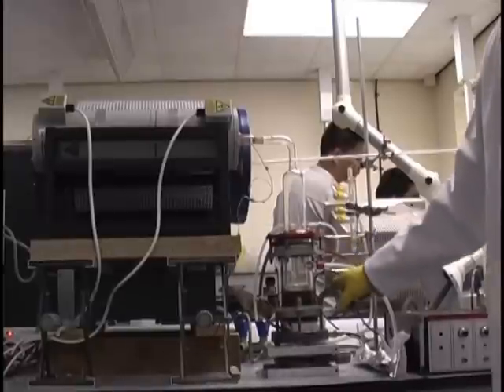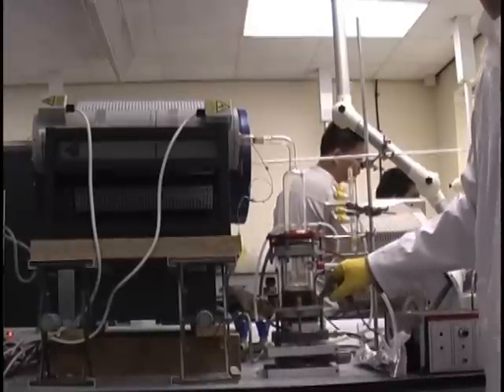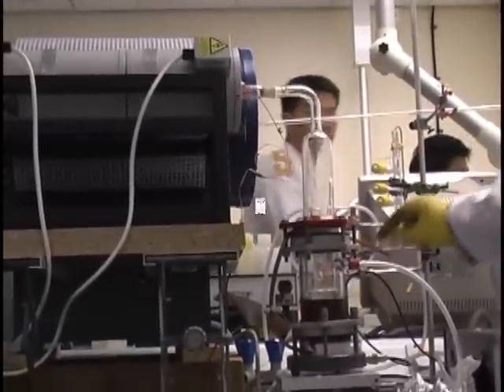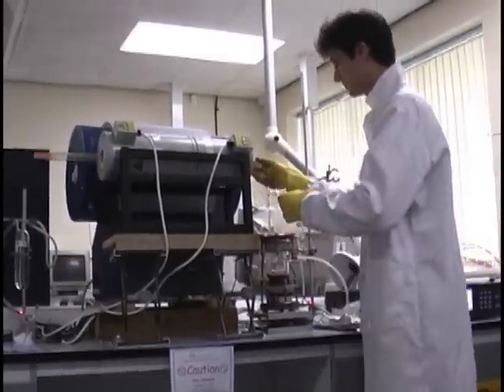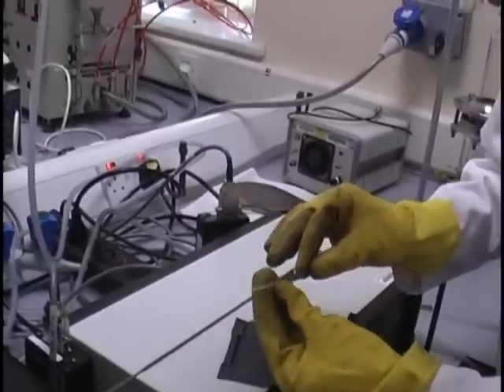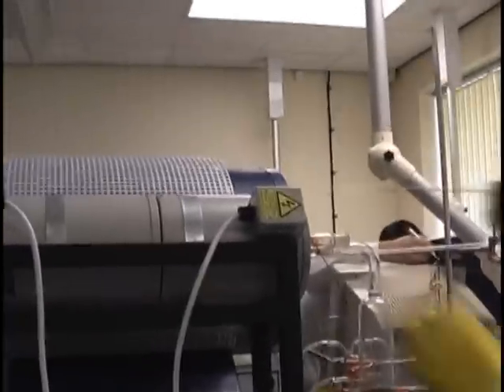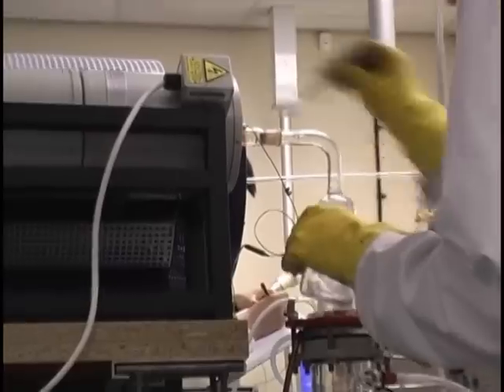In this CVD machine at Oxford University, the metal is included in the starting molecules. They use ferrocene, which contains one iron atom per molecule. The young scientist takes a clean tube and sets up the experiment. He introduces a clean base in the tube and closes all empty space with heat-resistant cotton to keep the heating.